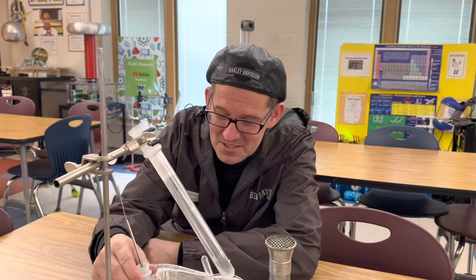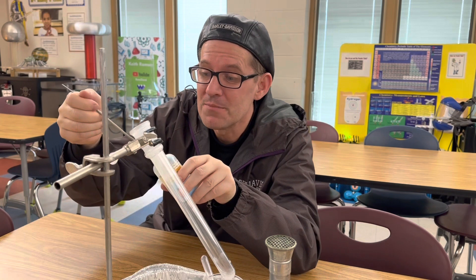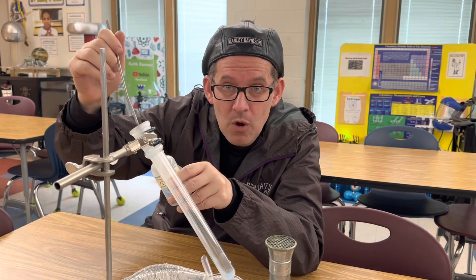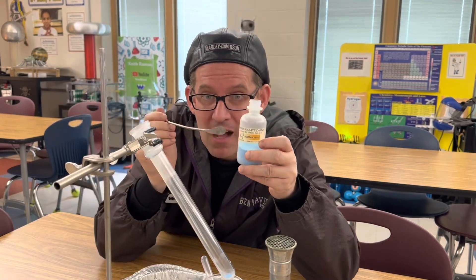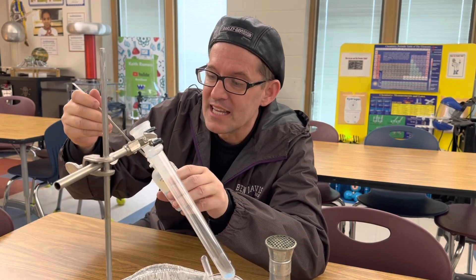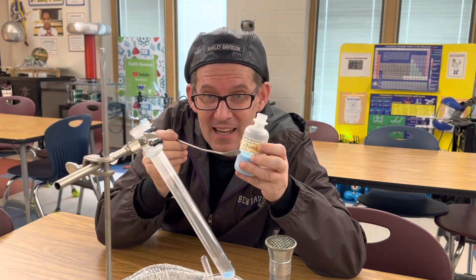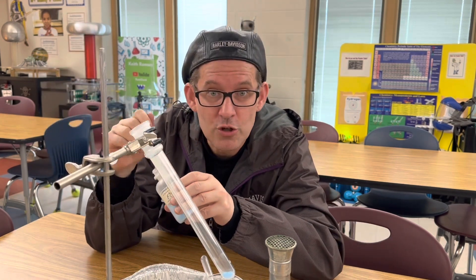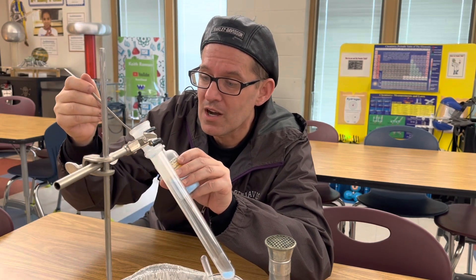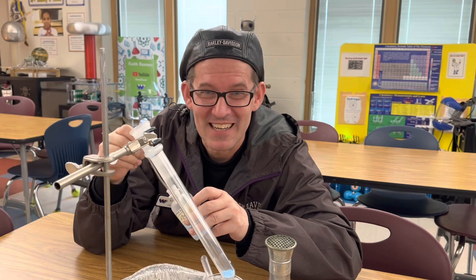To begin, I'm going to start adding my copper sulfate to my boiling tube. Now, as I do that, remember that this is really copper sulfate pentahydrate, meaning that there are five water molecules for every molecule of copper sulfate. So as we heat that up in our boiling tube, it's going to become anhydrous copper sulfate as those water molecules evaporate out of the compound and it'll turn white. And then we can reverse the reaction simply by adding drops of water and that compound will turn back to this beautiful blue copper sulfate pentahydrate.